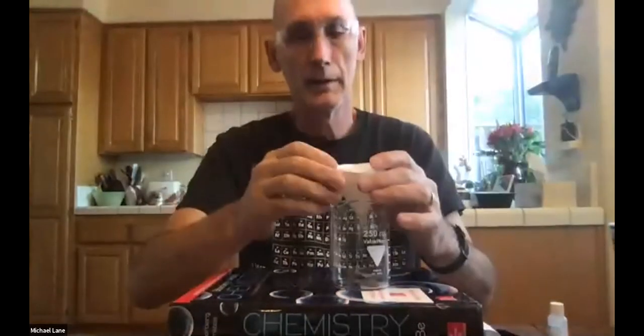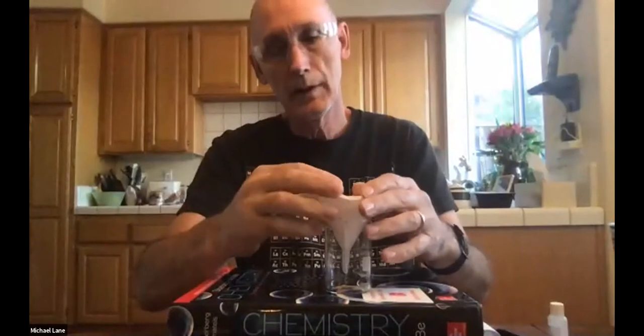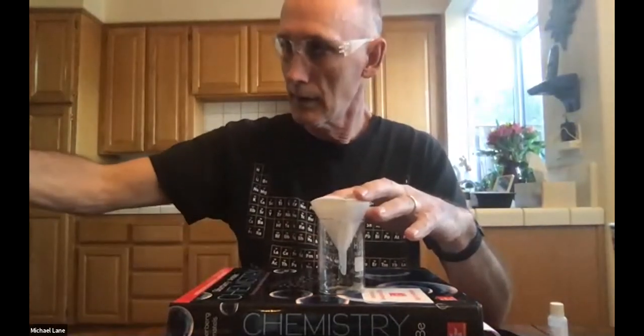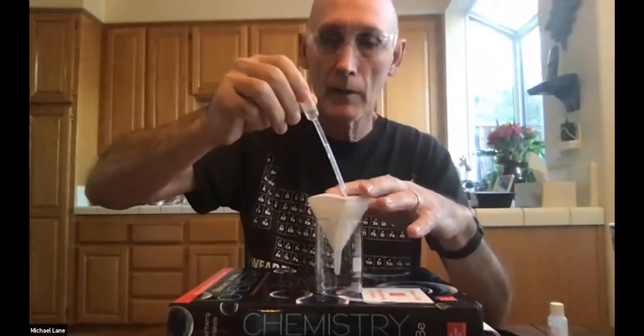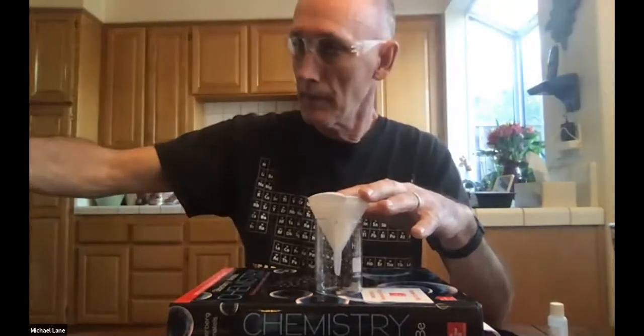Again, I'm going to get that, maybe not that one. Let me come back over here. This is my beaker that I've now used. I don't need it. I'm going to get that set up in there. And to keep this down in here, I'm holding it in there, and I'm going to get it wet. Now, shame on me, I did measure the mass of this filter paper.